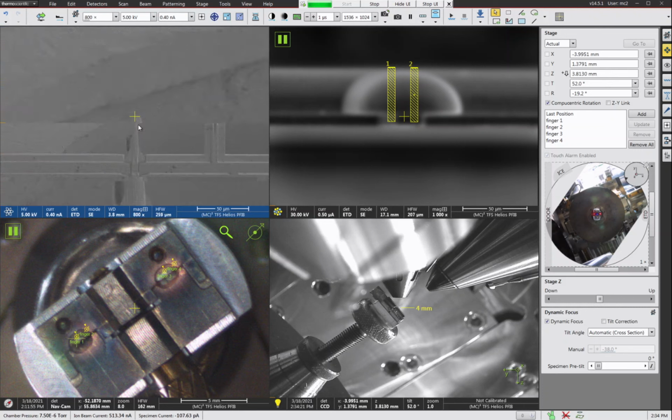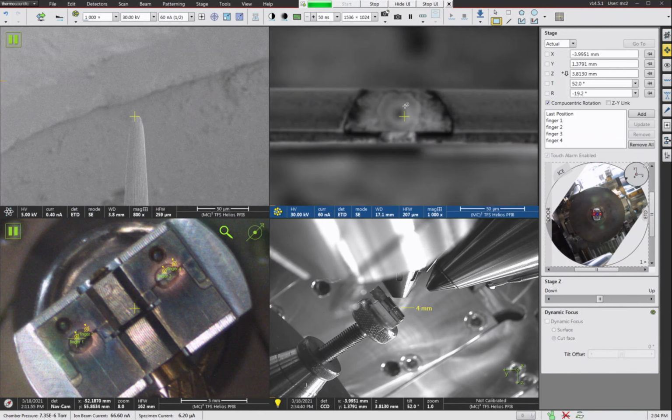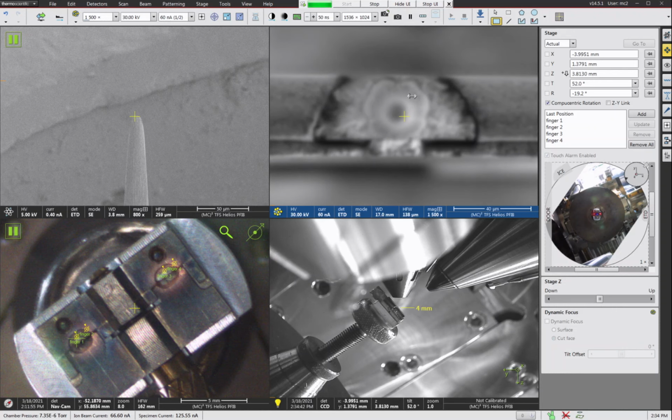So we did our 0.5 microamp cut with the 20 micron circle pattern and the 20 micron depth. The second cut we're going to do is we're going to drop our beam current to 60 nanoamps. And let's make sure our focus is reasonable. It should be pretty close. Okay, good enough. You want to focus on the top of the post if possible.